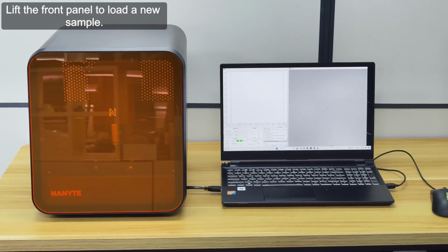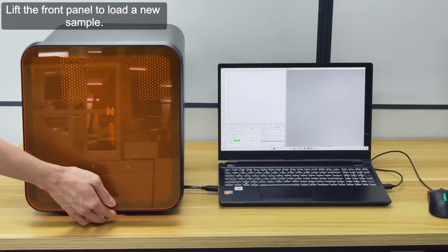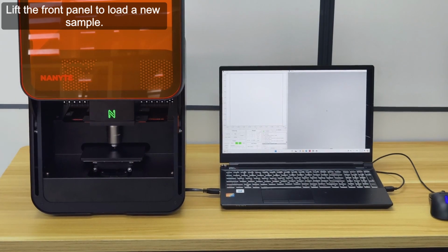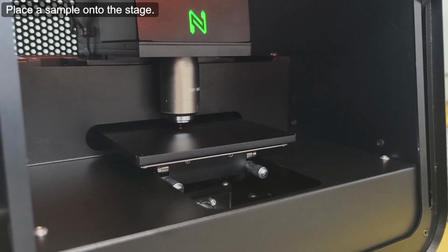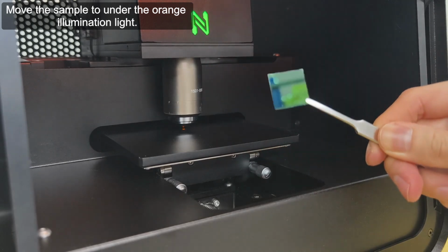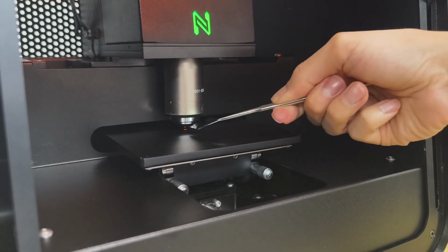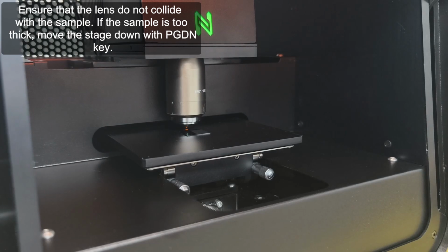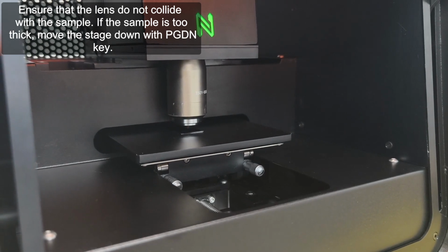Lift the front panel to load a new sample. Place a sample onto the stage. Move the sample to under the orange illumination light. Ensure that the lens do not collide with the sample. If the sample is too thick, move the stage down with the page down key.